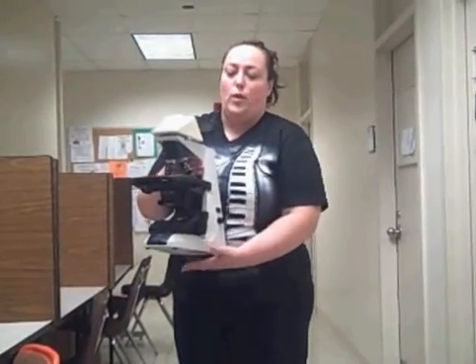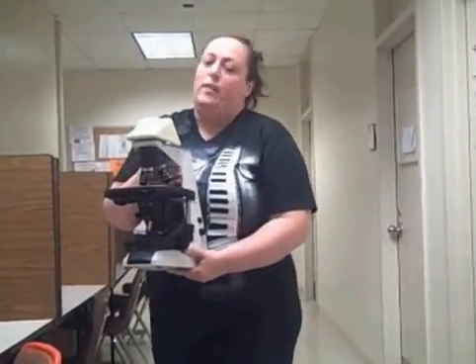First of all, carrying a microscope, you always carry it with two hands, one underneath the base, one underneath the arm. You bring it over to your table and set it down.